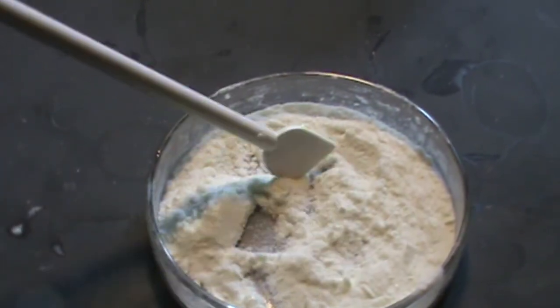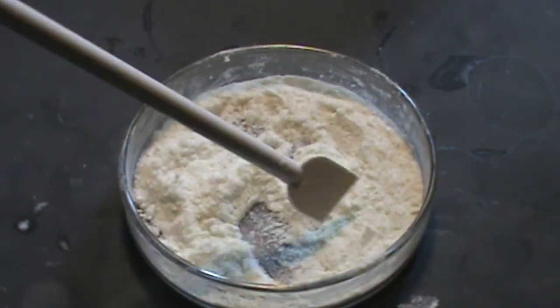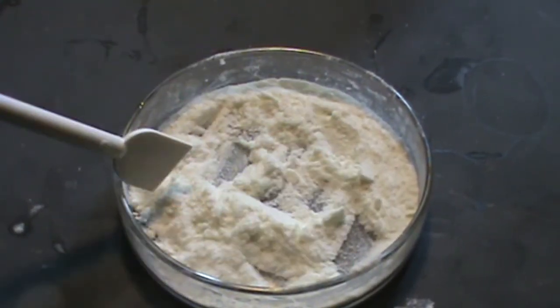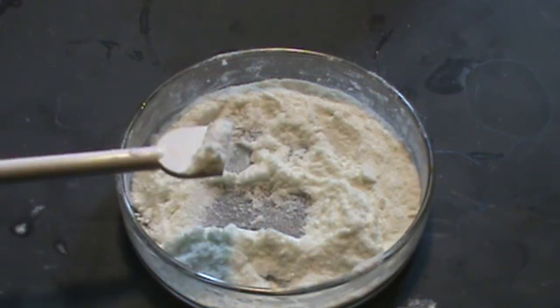For lack of a better name, I think that this would best be called lanthanide carbonate, as it likely contains a number of different lanthanides.